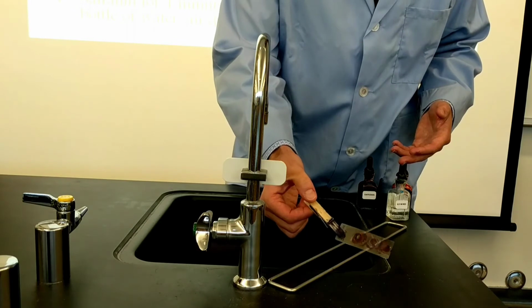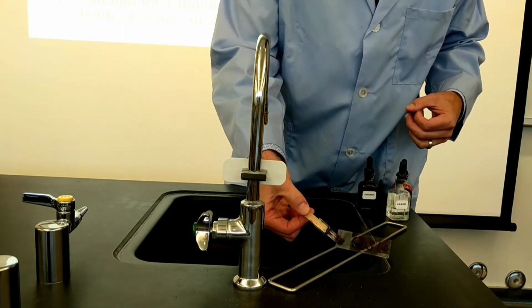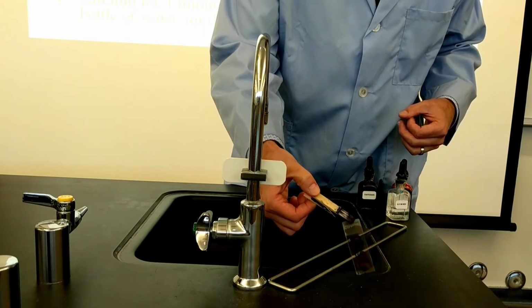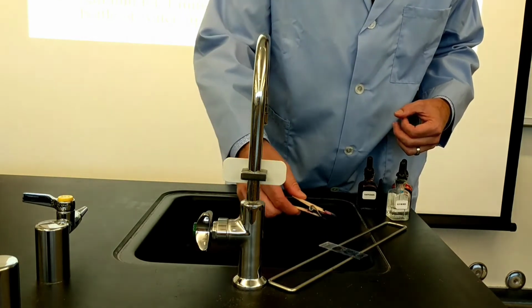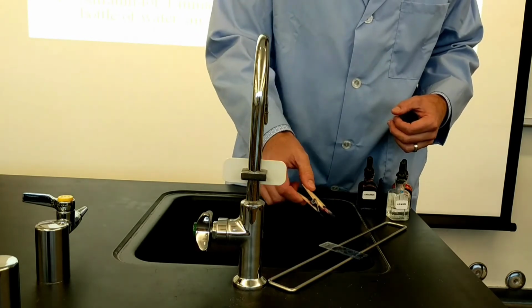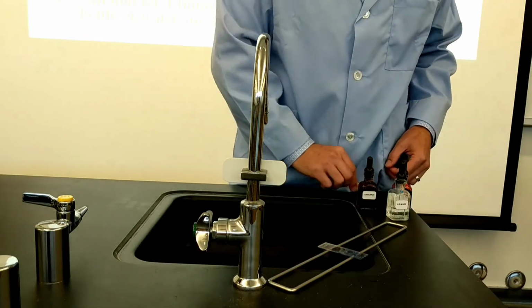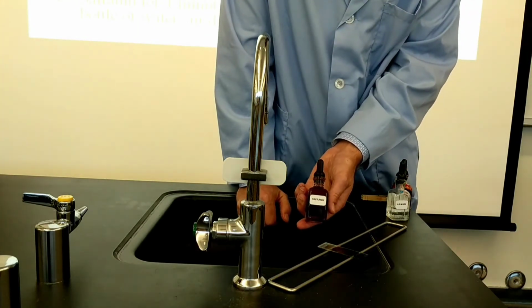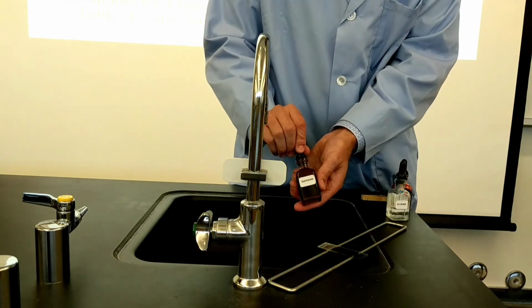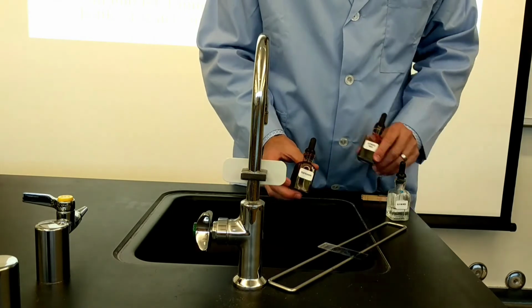Now you can see that the hydrochloric acid did take up some of the dye, and it looks spotty or patchy now, and we're not going to rinse that. If you rinse it, it can wash off even more. So this is a really delicate staining process, but it did turn out well so far. We're going to follow up with the last step, an application of a red dye called safranin. You would not want to mix up the two red dyes.